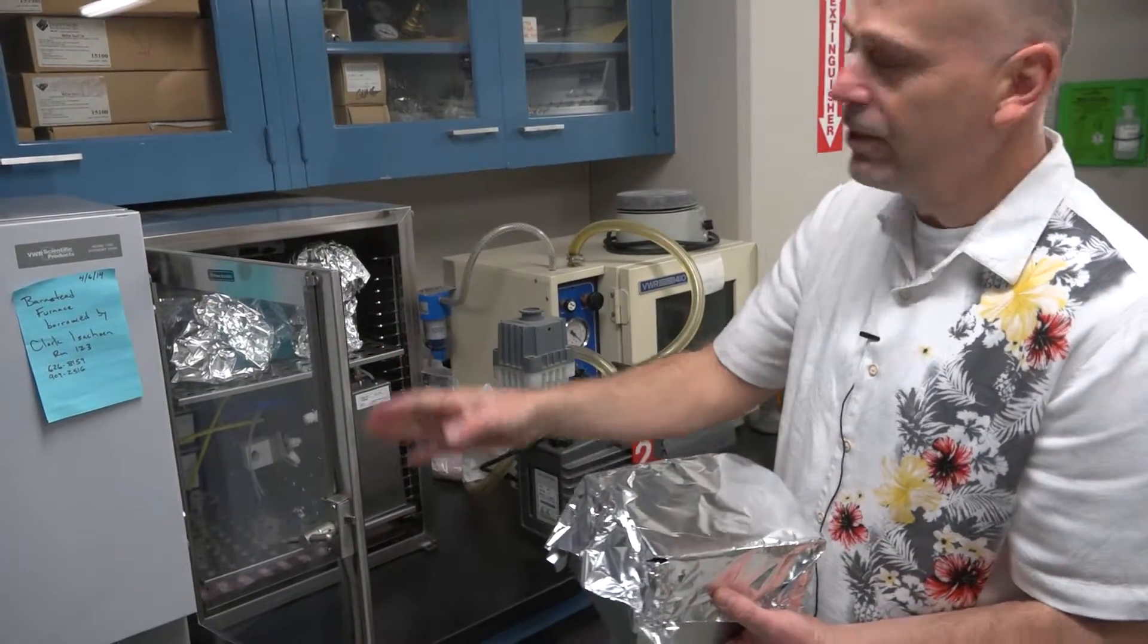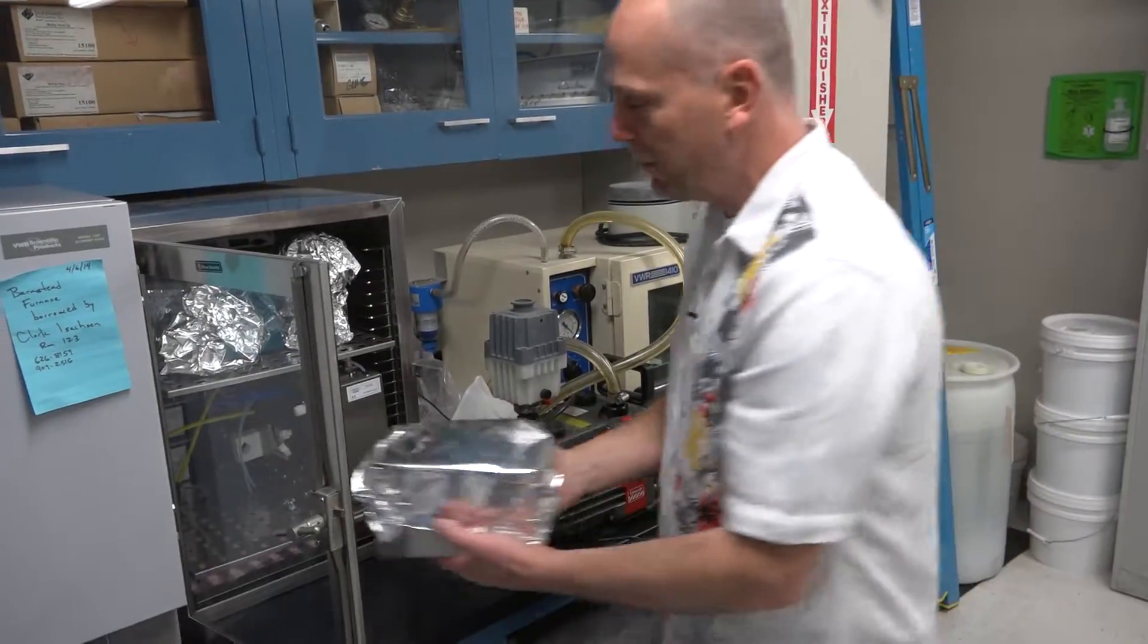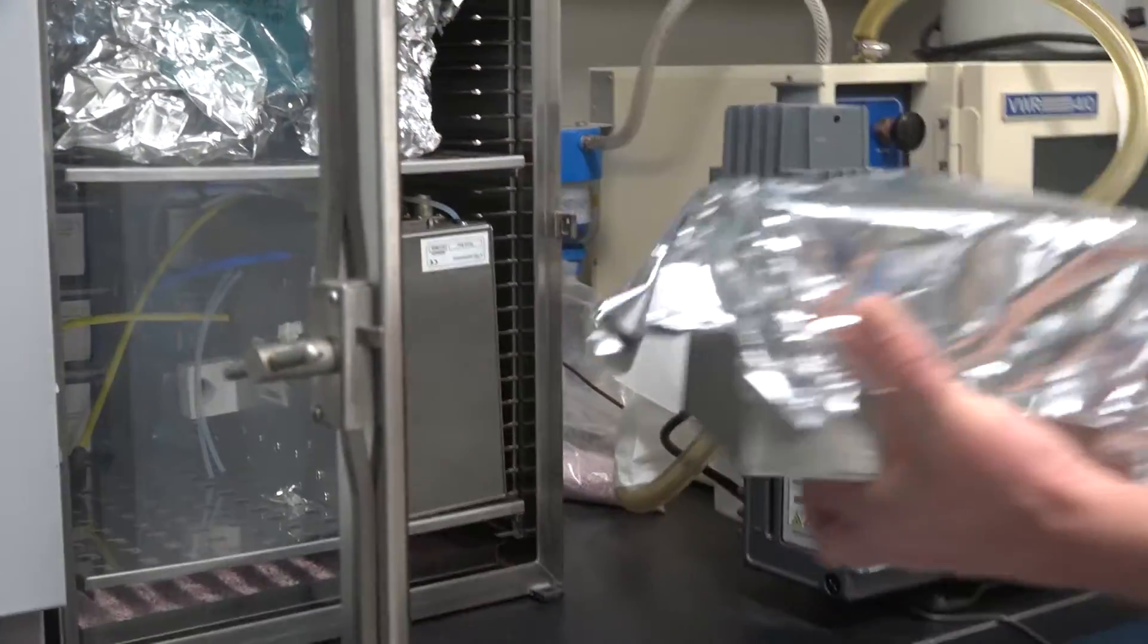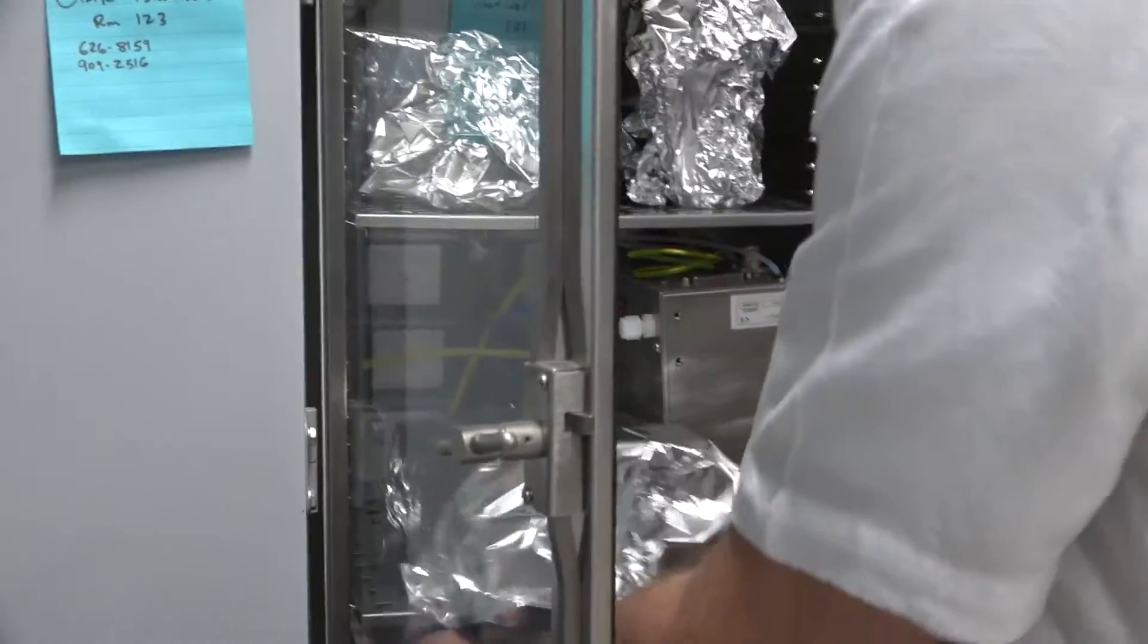Anytime you have electrical components that are not being used, it's best to store them in a dry box. This is the preamp housing that we just removed.